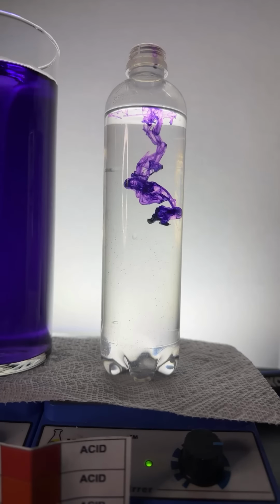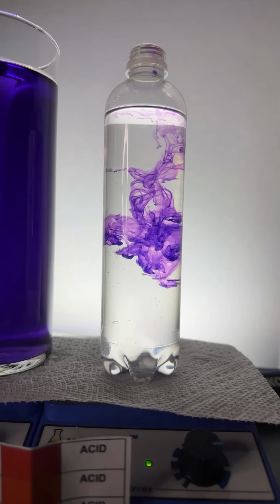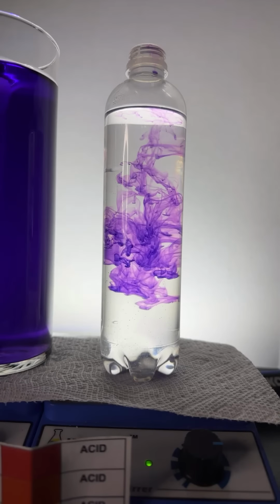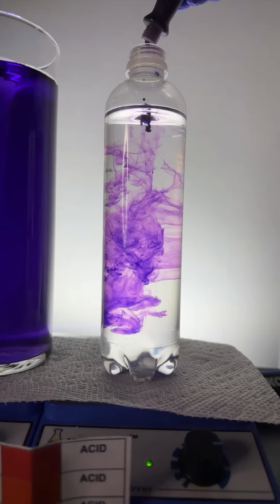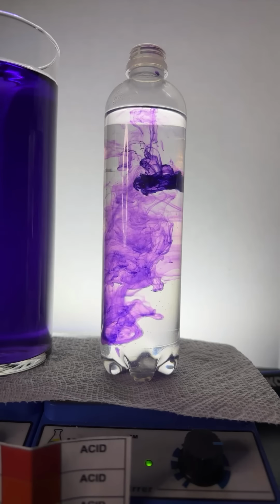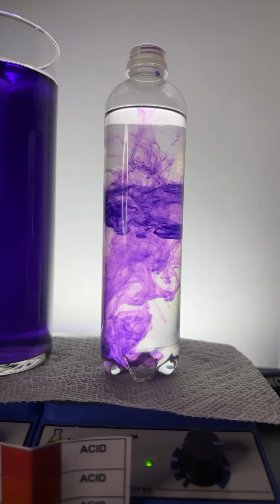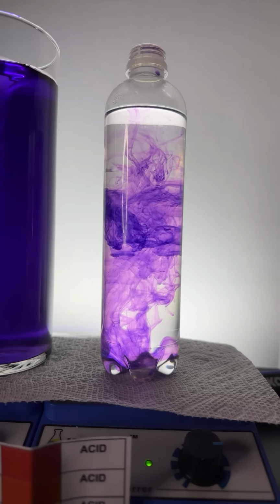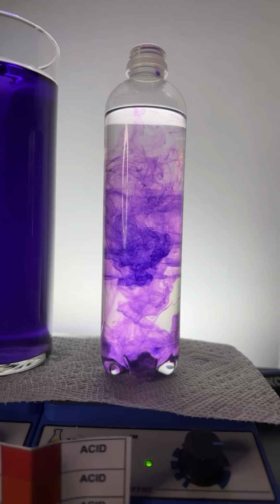And that looks beautiful in its own right, doesn't it? I mean, just look at the way the dye just kind of meanders through the water. Well, it's not water. It's water and acetone, right? Is that another drop? Just gorgeous to watch, you know, just nature do its thing. It just does random things, but it looks beautiful. It's really interesting how randomness can look so beautiful.